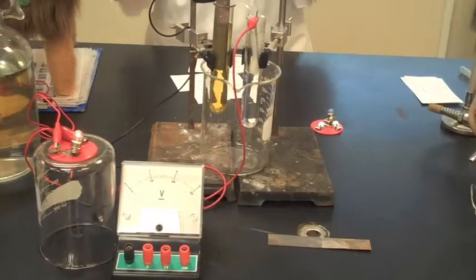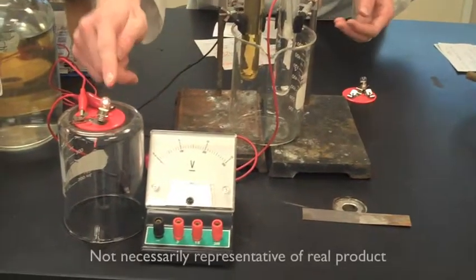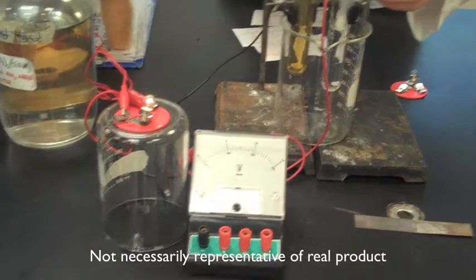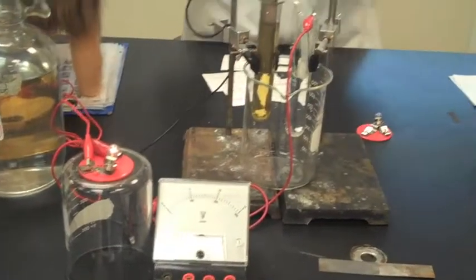So after that terrible explanation of what is actually going on here, you can see with this light bulb right here that's lighting up, it means that there's an electric current going through these cables and into here. Now we're going to explain how this happens.